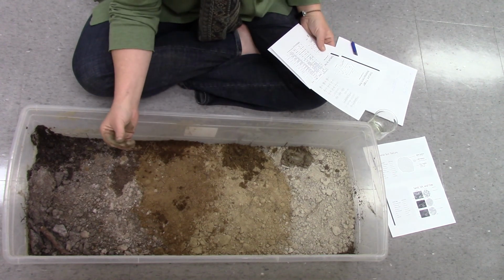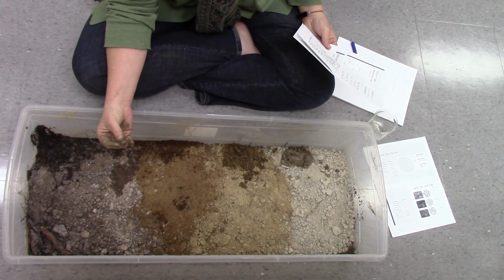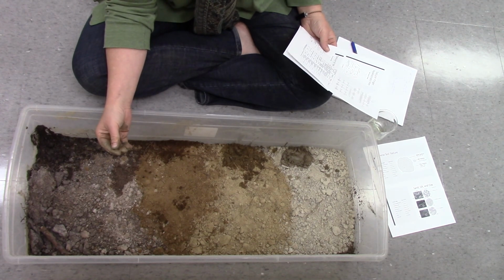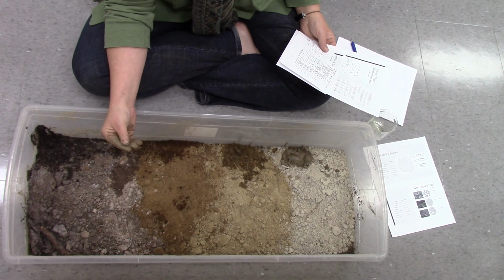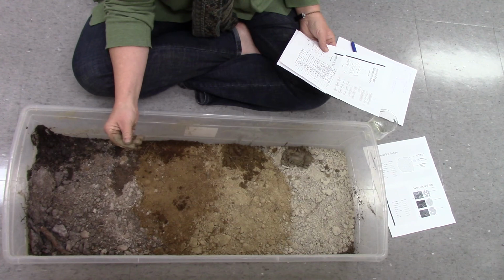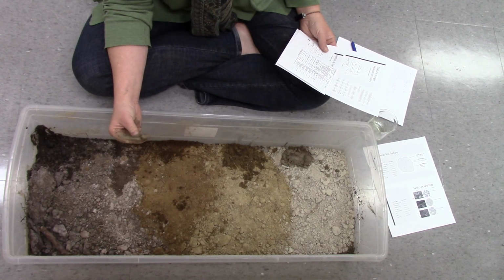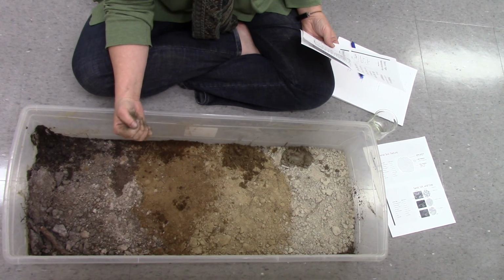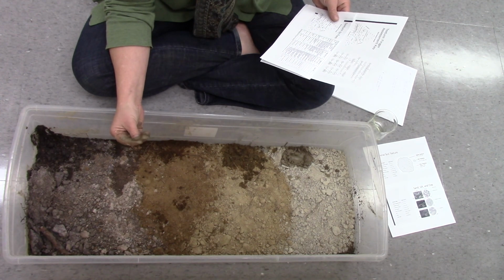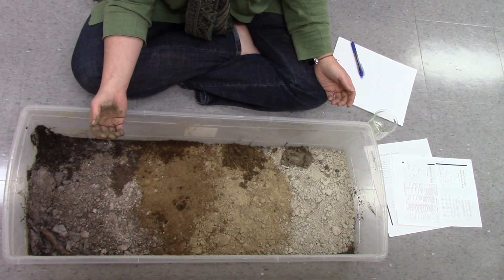So this will be interesting to do our hydrometer on. It will be interesting to use the hydrometer or the Imhoff cone and see what percentages we get of sand, silt, and clay. Frequently people will think they have clay and they actually have silt because they both feel so smooth to the fingers. This does have a grittiness to it though. It just has a silkiness as well. Cool. Okay, go have some fun playing in dirt.